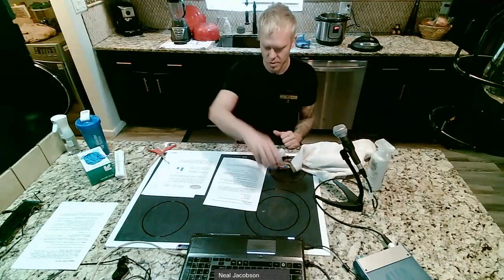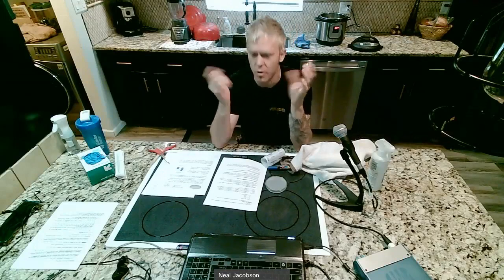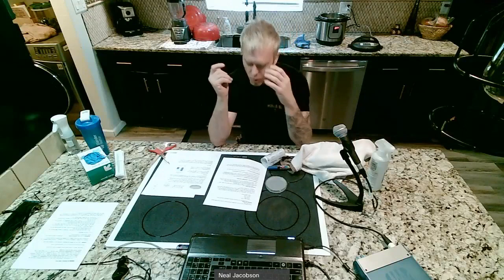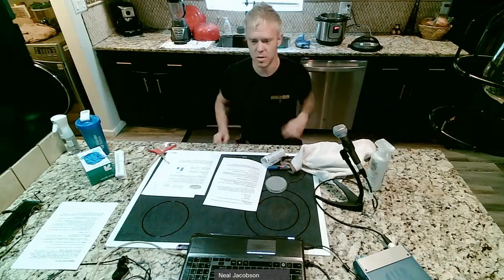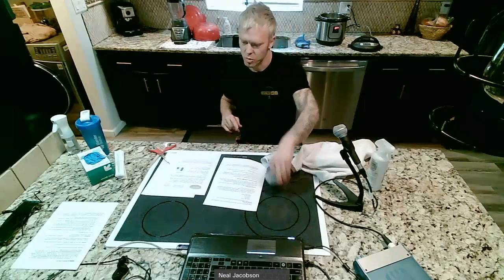Okay, so we're gonna take our petri dish and you're gonna divide a line. So you're gonna draw on the bottom. You're gonna draw a line down the middle, and one side you're gonna label before, one side you're gonna label after. Now you can write a B, you can write an A, whatever you'd like to do, as long as you can keep the two straight. And so what we're gonna do is we're going to open the plate.